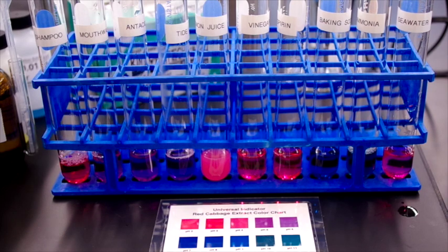Alright, and that's the indicator portion of this pH test.